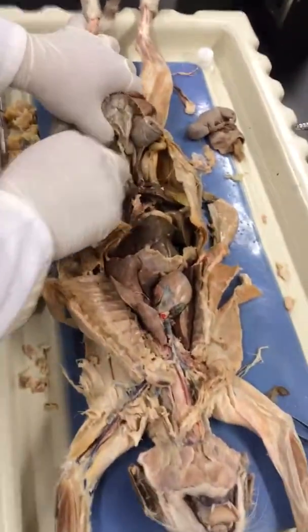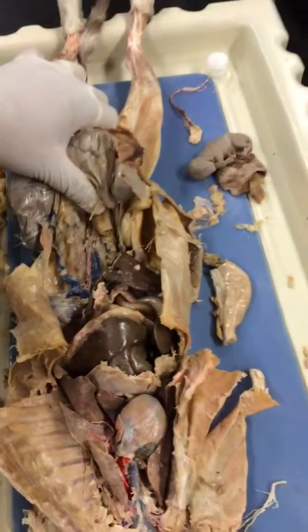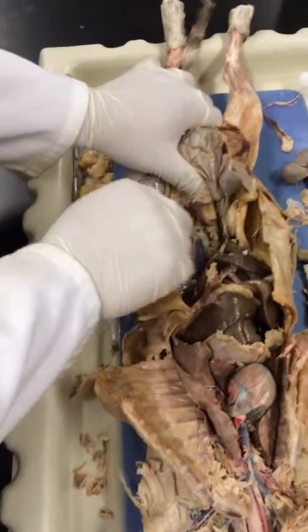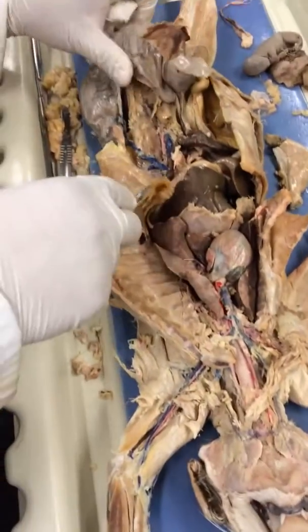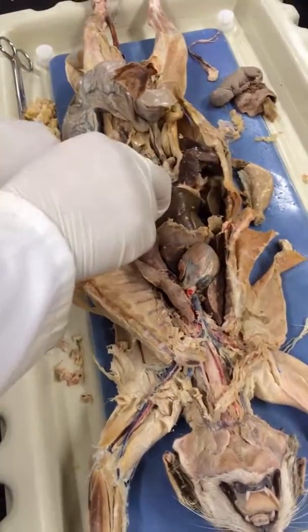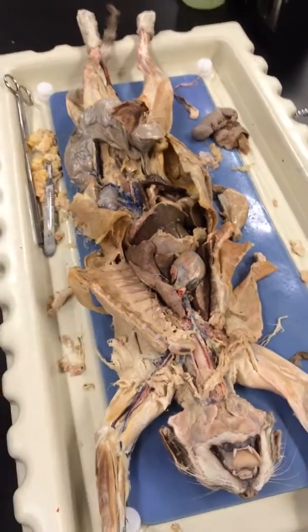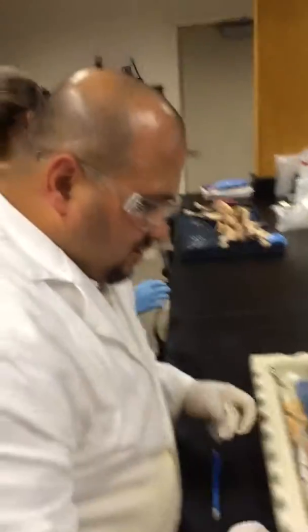And I think that's all we can really see. You guys need to really look at either someone else's cat for the iliacs here. Theirs is good. Yours is pretty good. Theirs in the corner is also pretty good. Or you can keep picking it up. But otherwise, everything else in yours is good. There's still just a lot of loose connective tissue that you can blot out or take out. All right, so those are some of the major ones.